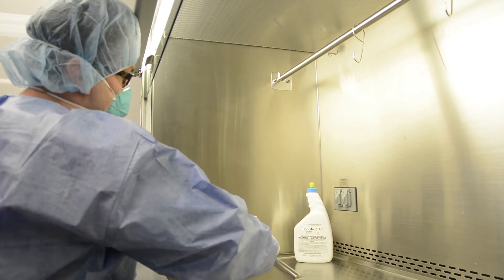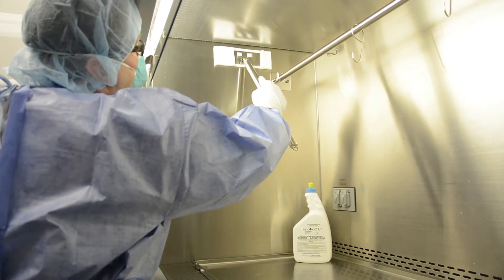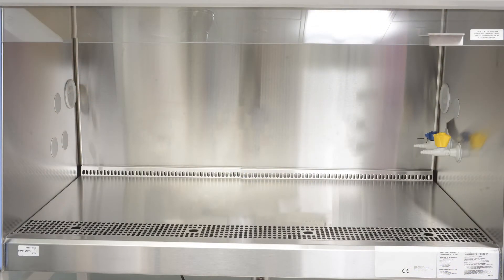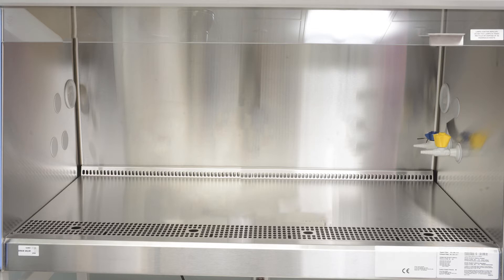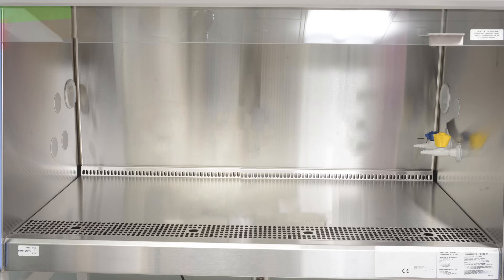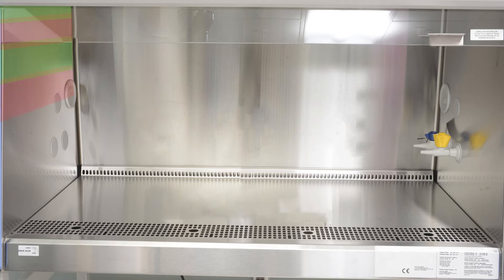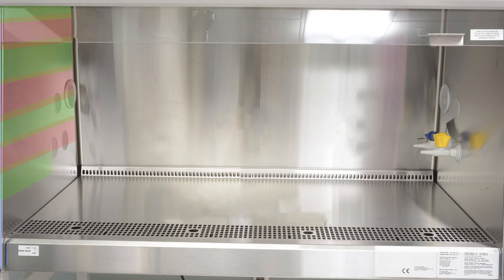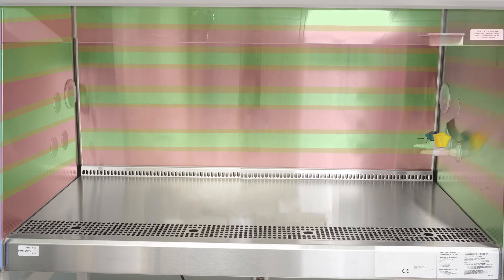To ensure the surfaces of your primary engineering control are properly decontaminated, cleaned, and disinfected, the correct wiping techniques must be employed. The most commonly accepted practice is to start at the left side of your primary engineering control and work to the right. To clean the left side panel, start at the top left corner, wiping from left to right. Using overlapping strokes, continue wiping the surface working from the top of the unit to the bottom. Repeat this process for the back wall followed by the right.